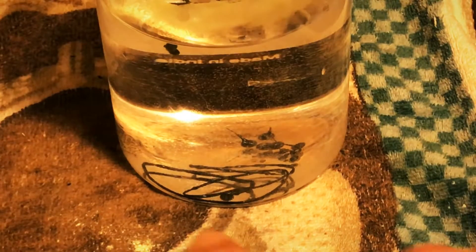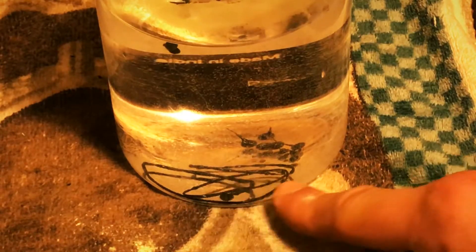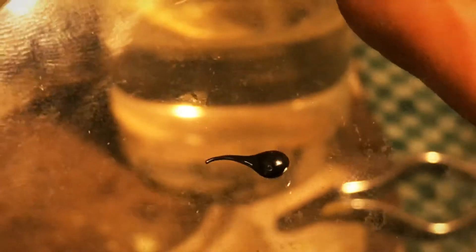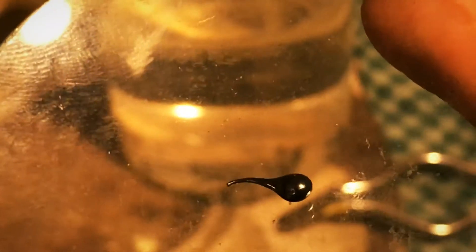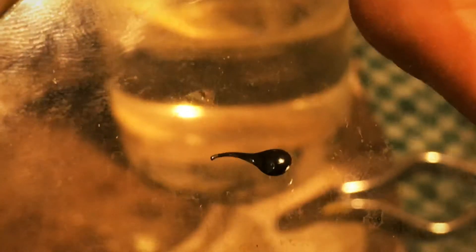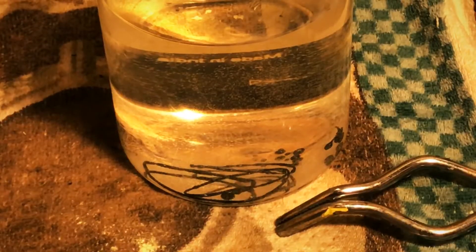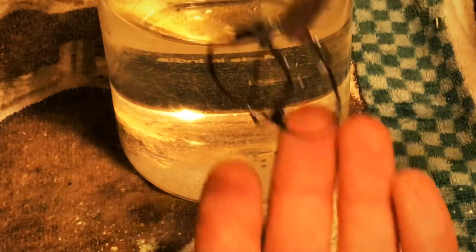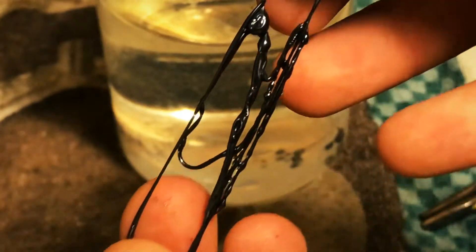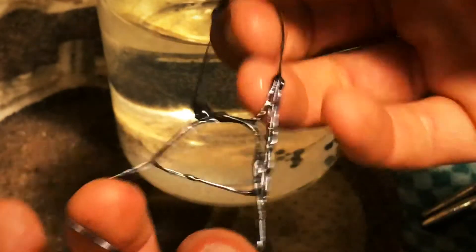I am going to pour the molten sulfur directly into the cold water. What you see here is amorphous sulfur. If you look very closely, this is a Prince Rupert amorphous sulfur droplet. What I am going to show is the interesting characteristics of this amorphous sulfur — as you can tell, it is very dough-like and it is actually quite elastic.